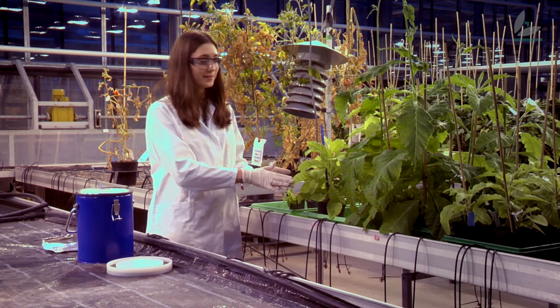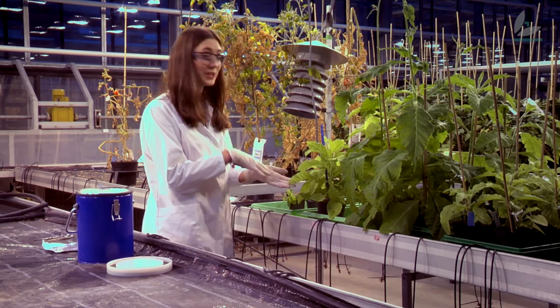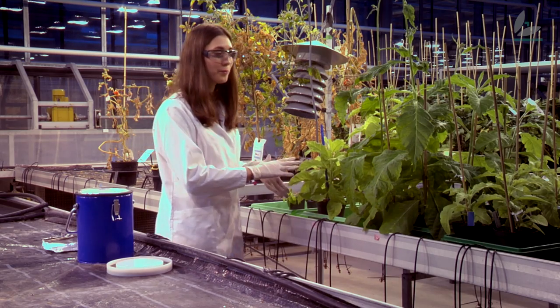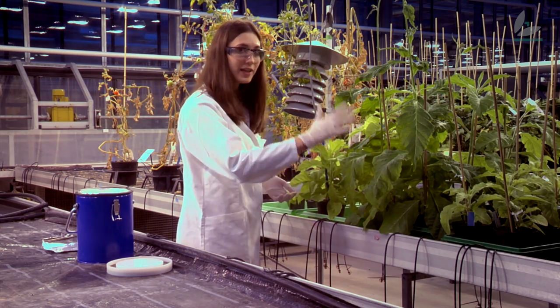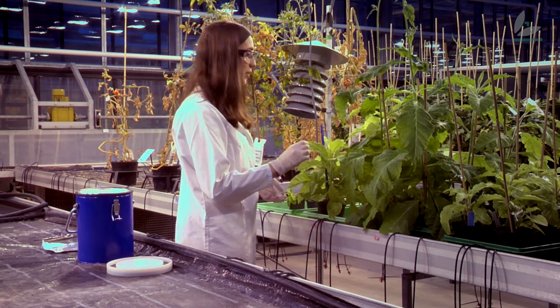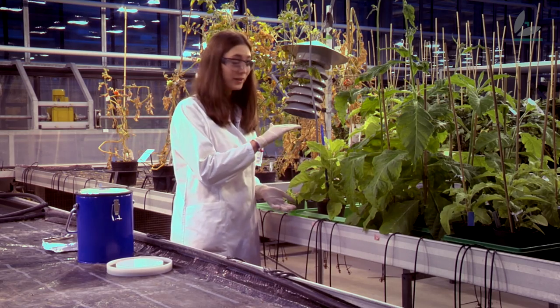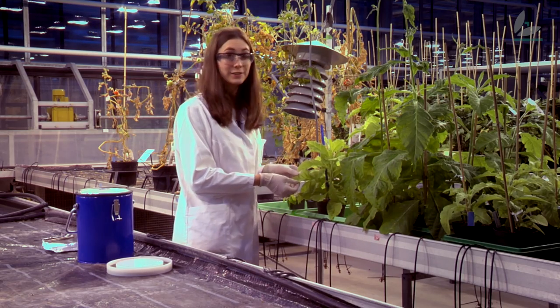Here we can see other plants that also contain my gene but they're a little bit older. If we compare them with plants that do not contain my gene, we can see that they are a bit smaller and also lighter.